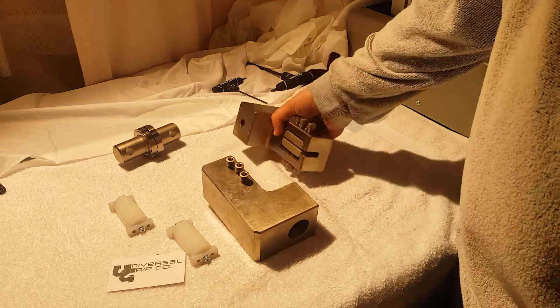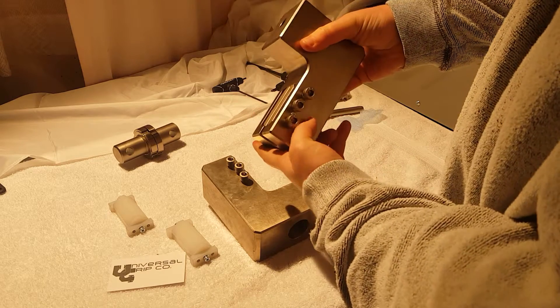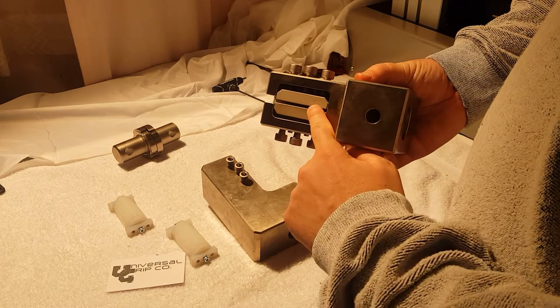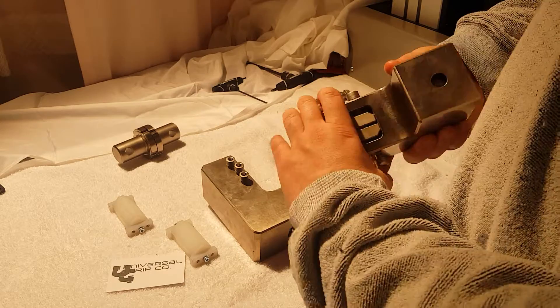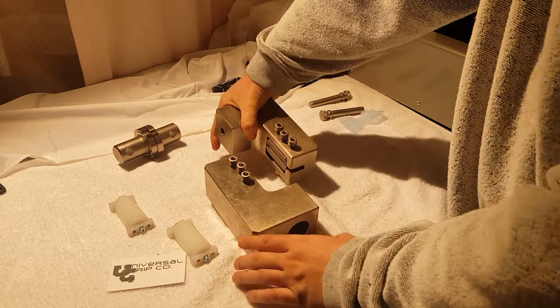So back to the ASTM D7078 fixture. You'll see there are six tightening pins here. They tighten some vise grips and that's where the sample goes right inside there, and then the whole fixture is pulled to shear the sample.